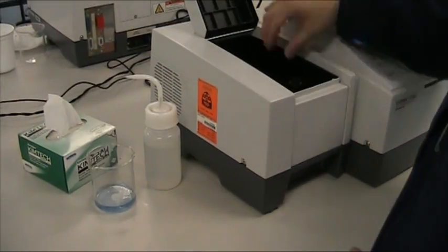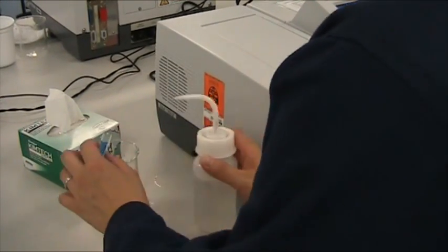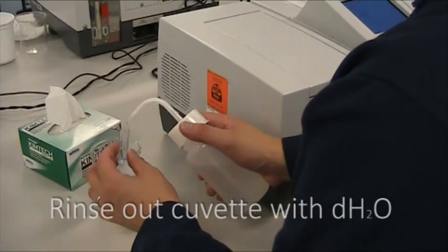Remove the cuvette from the receptacle. If you are discarding the solution, pour it into the liquid waste beaker. Rinse out the cuvette as before.